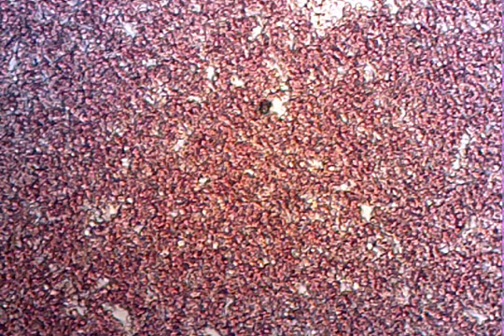All right, so here's our third slide. We're at 40 times magnification. We're going to go up to 400. So there's 100. There still might be a little bit of movement. I can't tell. All right, let's go to the next one.